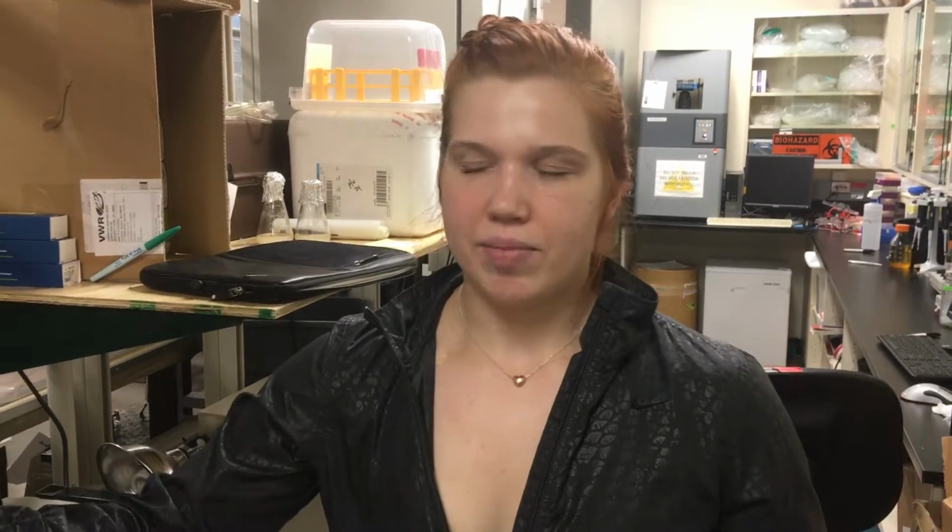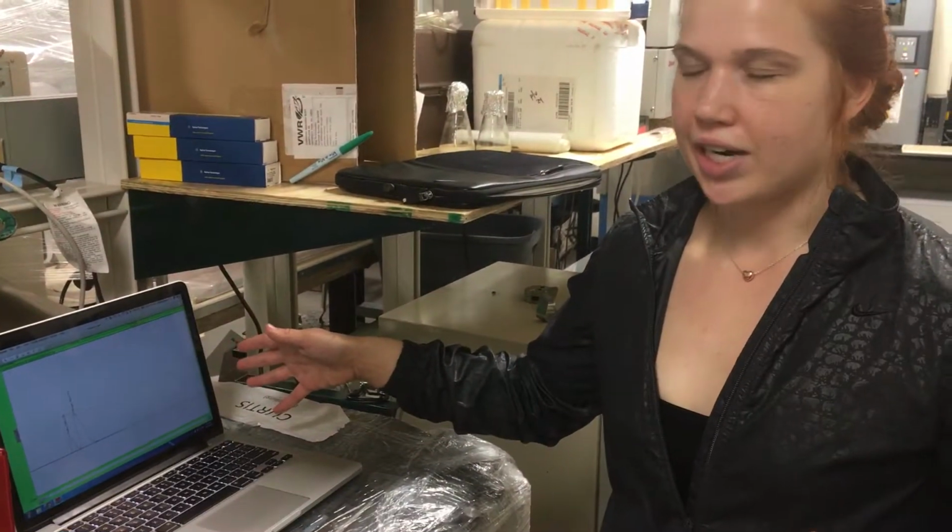There is an SOP written called Using the GC Sarah Jean's Way. I highly recommend that you use that to understand a very basic setup for a simple injection, rather than having a continuously fed sample. If you understand how to set it up this very simple way, you should be able to configure the GC in any way you want, because the whole purpose of this is to configure it for whatever your needs are. If you have headspace or some kind of gaseous space that you want to analyze, depending on how frequently you want to analyze it, you can connect it to this GC and the program and some kind of computer to analyze it in however way you want.